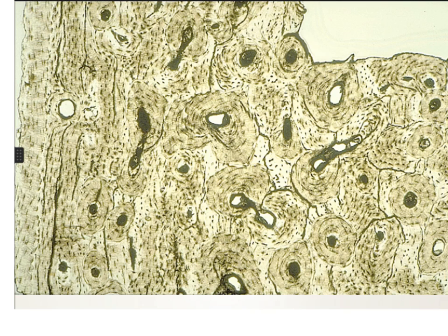So by this method you can only see the calcified tissue in the bone, and you never see living cells. This is the ground bone, and it is compact because it has the regular arrangement of this Haversian system here, so it is a compact bone and not a spongy bone. Moreover, the spongy bone cannot be prepared by the grinding method as it is very fragile, so it will be damaged by this method.